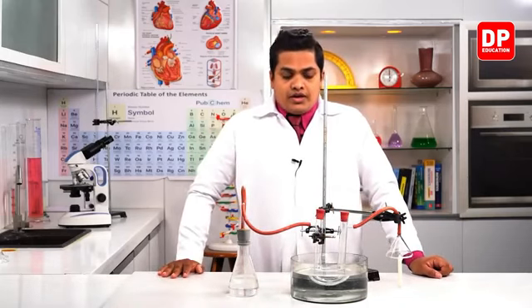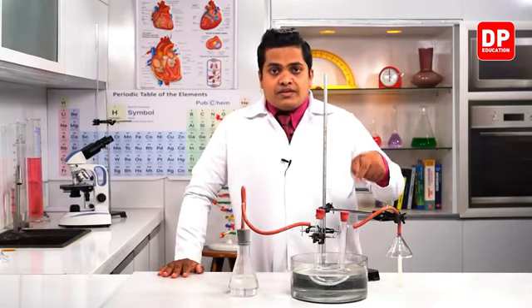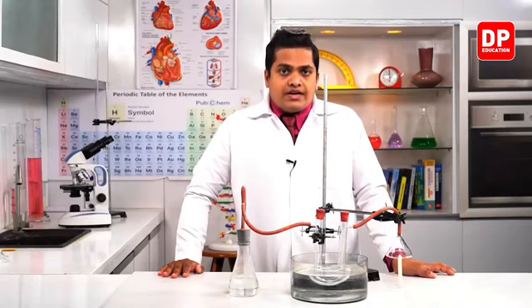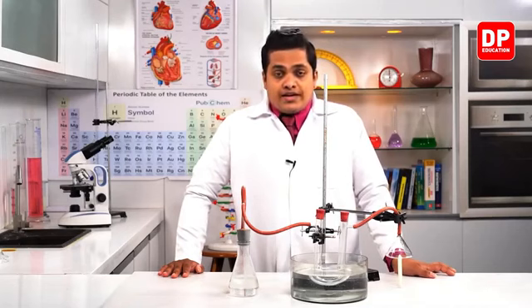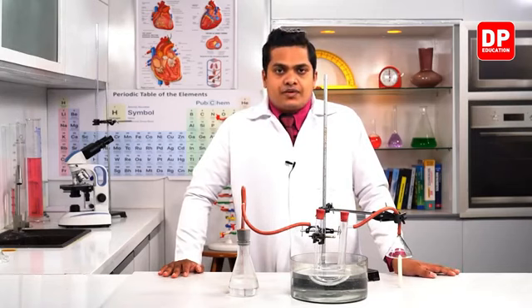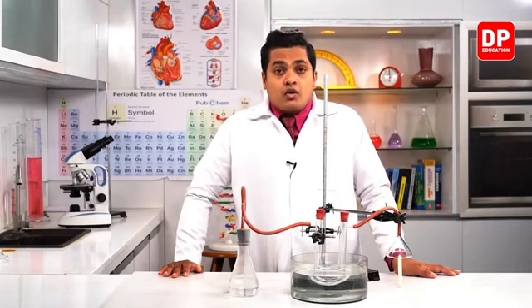So this is anhydrous copper sulfate, which I have prepared by heating hydrous copper sulfate. When water vapor is absorbed by it, the copper sulfate turns blue once again, its original color. But in order to do that, it should come in contact with water vapor, and the water vapor should be absorbed into the crystals.